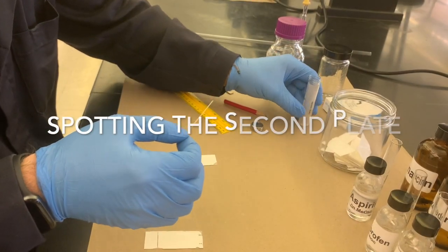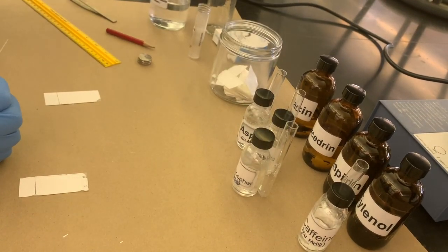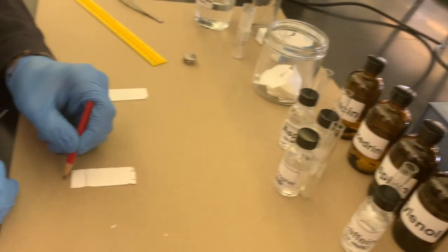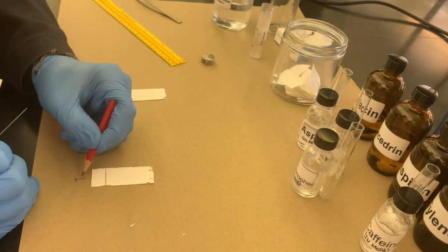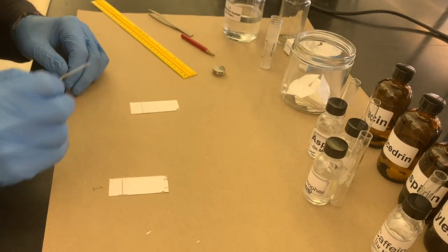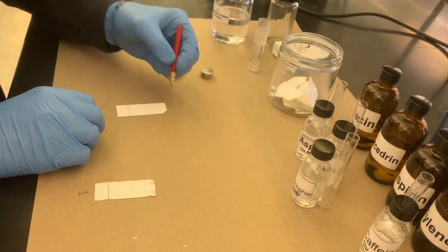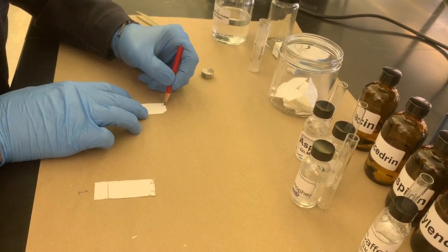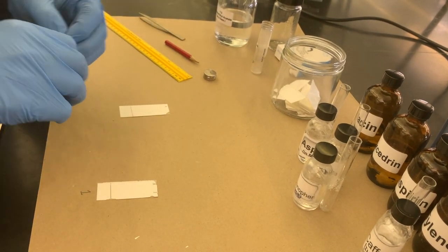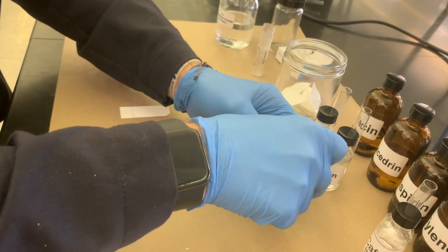Next, we're going to go to our next samples. So we have acetaminophen. In fact, in order to avoid confusing any of these samples, I'm just going to label this 1 for our first trial. So for our second trial, I'll put a 2 once it's out ready to dry. But acetaminophen is going to have an A, so we'll put that at the top of the sample in the silica. And we will take the lid off and get ourselves a little drink here.